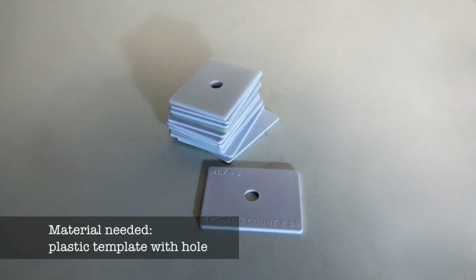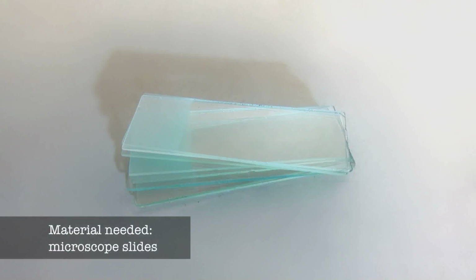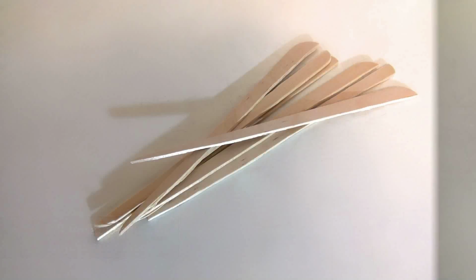A 1.5 mm thick plastic template with a 6 mm wide hole to measure the quantity of feces to be analyzed. Microscope slides to examine the specimen. Applicator sticks. Even wooden tongue depressors can be used for this purpose.